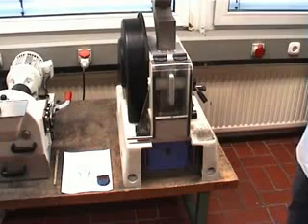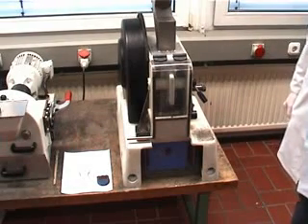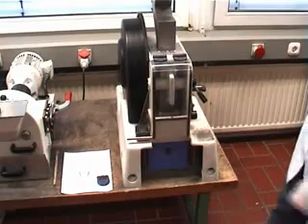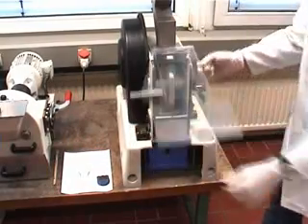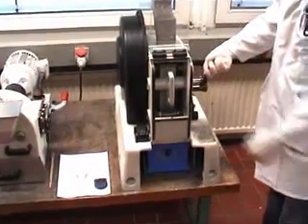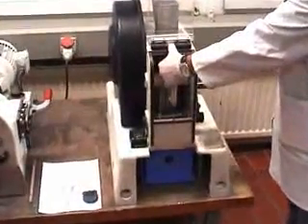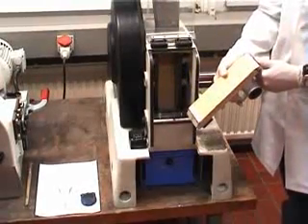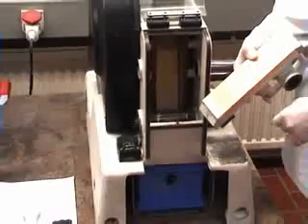After milling, it is important that the instrument can be cleaned very easily and very fast. Mr. Gabber will now demonstrate how to clean the milling chamber inside. You just have to remove one of the drawers and now the whole milling chamber is open for further cleaning with a vacuum cleaner and a brush. As you can see, for the sample we processed today, it is not very much contaminated by the product.